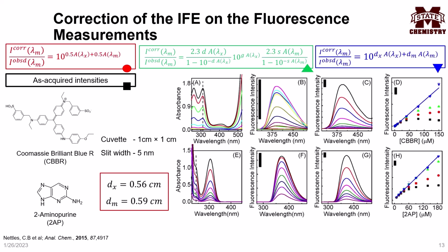The red, green and blue dots symbolize the intensities obtained after correcting the inner filter effect using equations 1, 2 and 3. As can be seen, the peak fluorescence intensity for the as-acquired fluorescence spectra has a poor linear correlation to the fluorophore concentration. Even equations 1 and 2 don't give a satisfactory linear correlation. But there is excellent linear correlation observed when equation 3 is used, suggesting a superior inner filter effect correction.